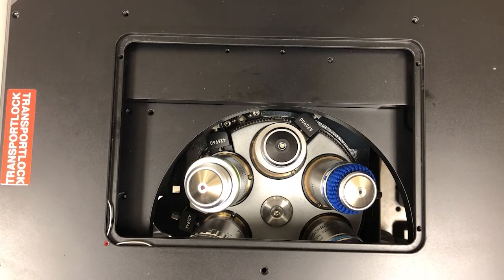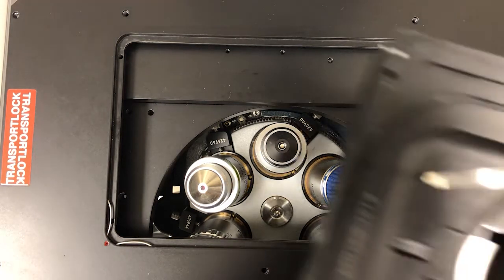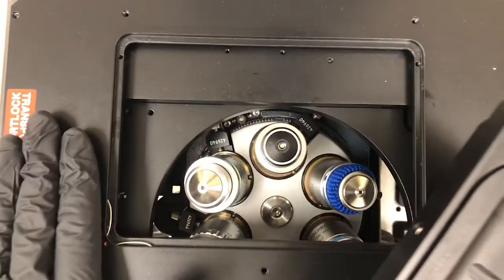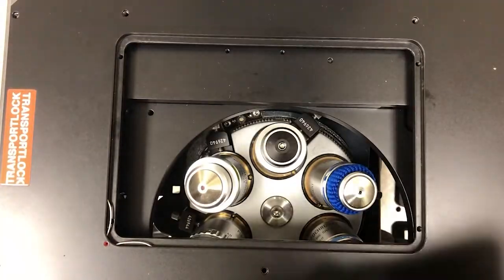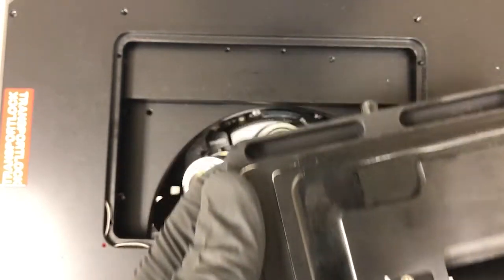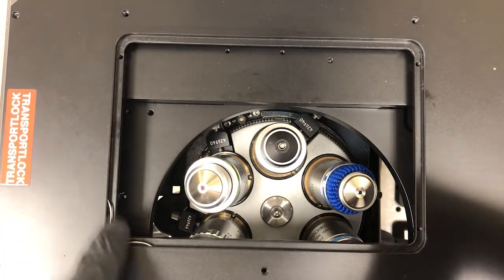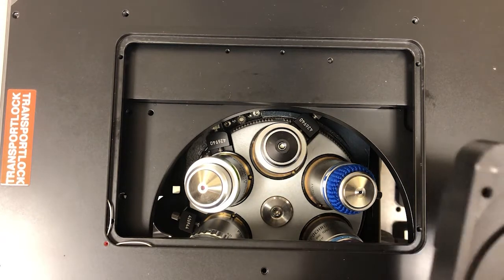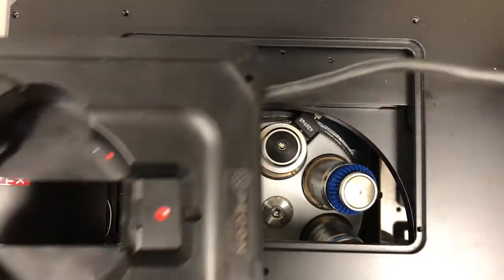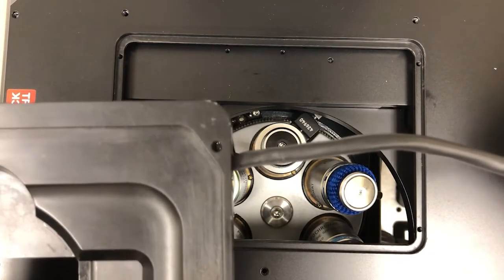So how do we put this on? You can see here the stage. If I flip it over, actually the stage insert, this is the stage. If I flip the stage insert over, you'll see there's sort of a groove here. Okay? So that is what needs to fit in this groove. I tend to put it with this cable on this corner, even though that red dot would seem to indicate it should go in that red dot. I just find it more comfortable to keep that cable out of the way there.